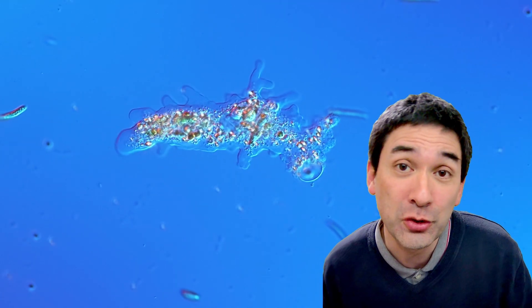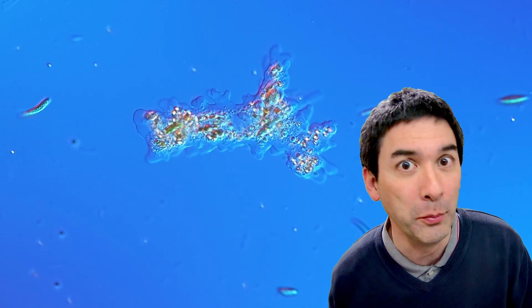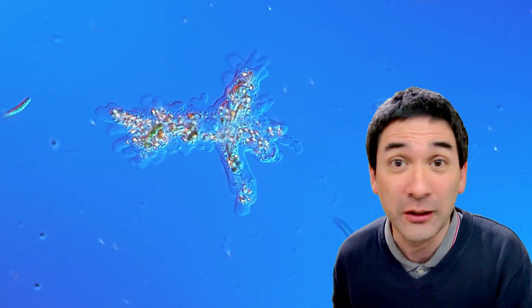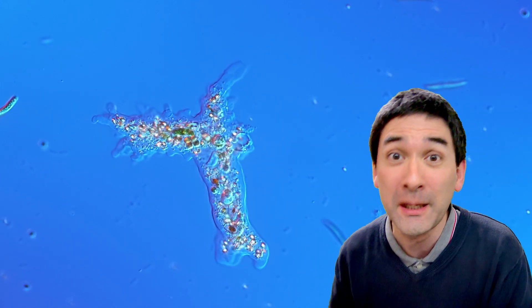Now why am I doing that? Well because I wanted to show you how a cell pops open. It's as simple as that, and I have to tell you I do not feel guilty about it. I don't feel bad about it.